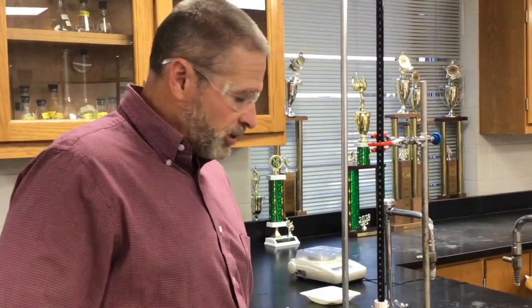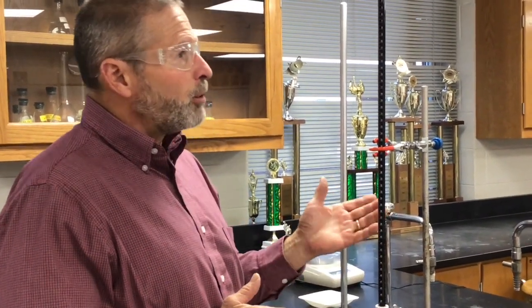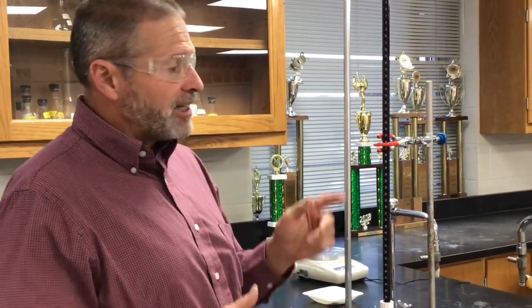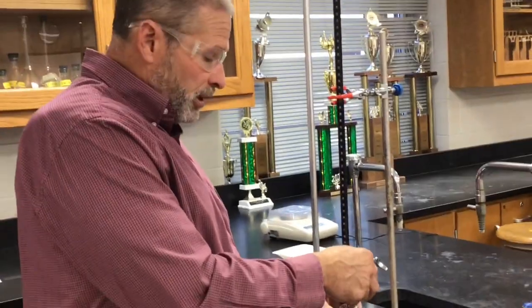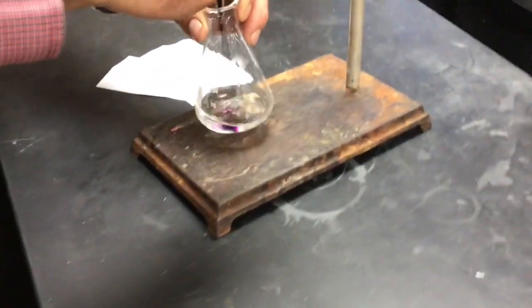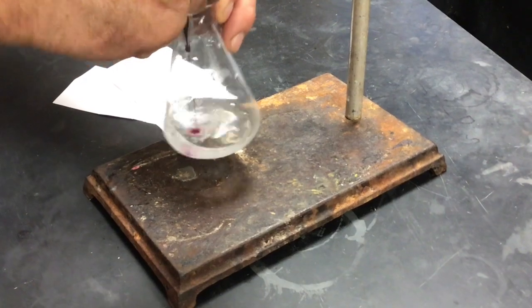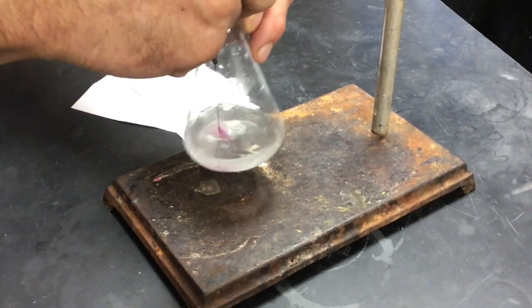Oh, one other thing too, I almost forgot. Permanganate is its own indicator. You recall the last acid-base lab, we had to put phenolphthalein in so there was a color change to mark the stoichiometric point. Well, permanganate's nice because it has its own color change. The manganese in the permanganate ion is in a different oxidation state than at the end. Right now it's got a nice deep purple color, but you're going to see that disappears because Mn+2 is colorless in solution. And so you see that purple very quickly disappear because there's a big excess of hydrogen peroxide.